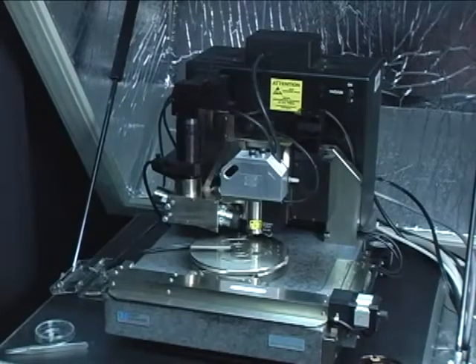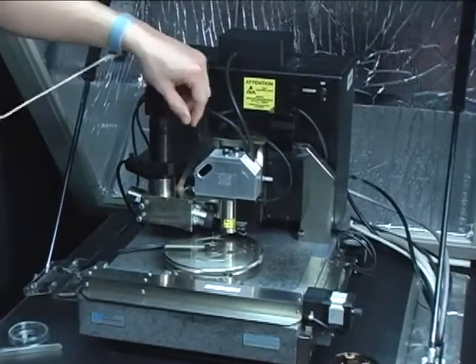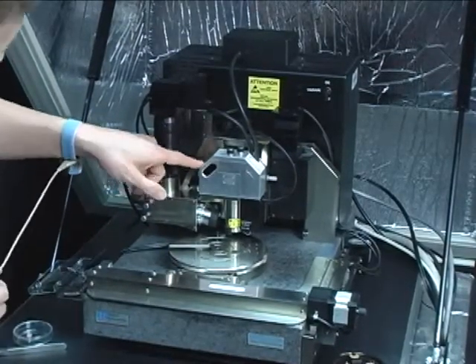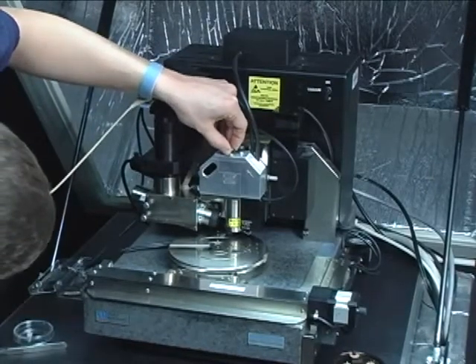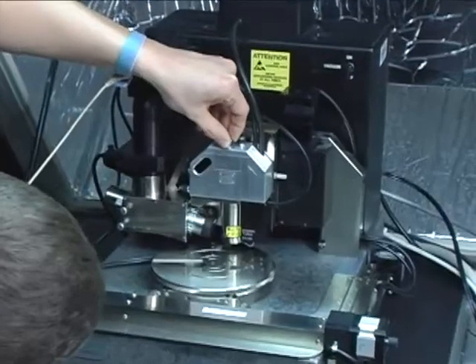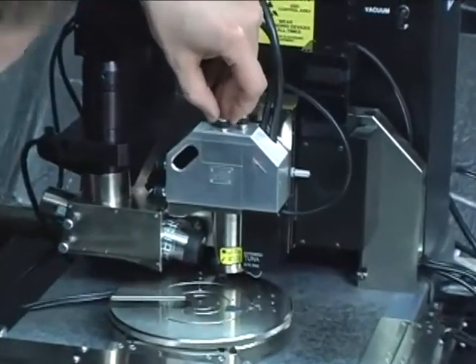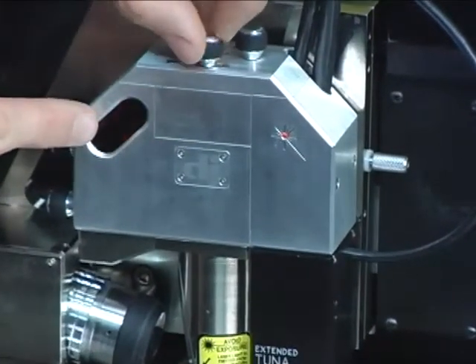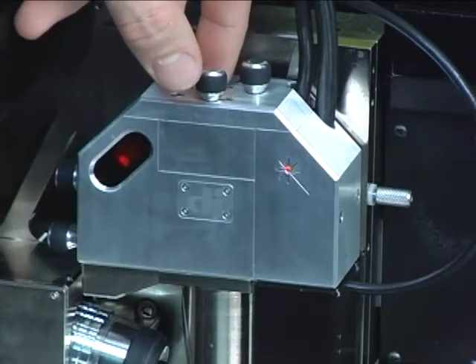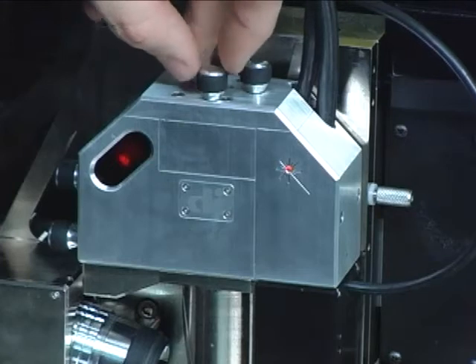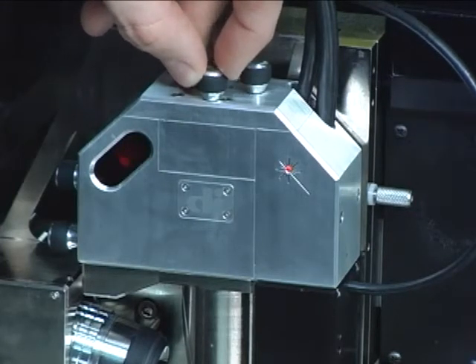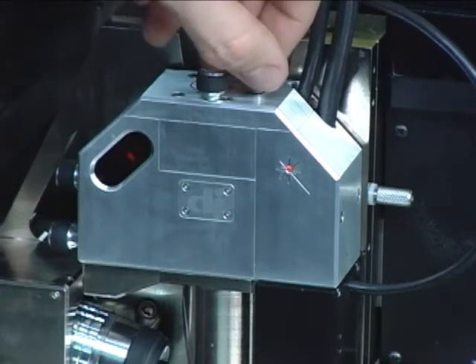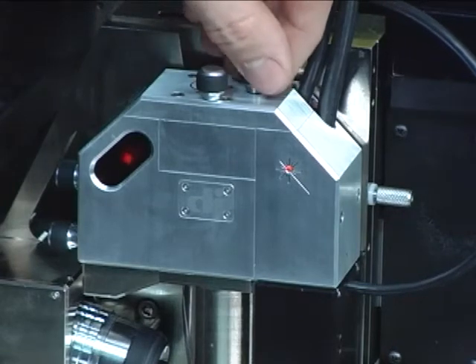Now that the tip is mounted in the system we can align the laser beam with the back side of the tip. And we'll do that by using these knobs to move the laser across the cantilever. And observing the reflection of the laser in this window. We can tell when our laser beam is on the back of the cantilever because moving it side to side our reflection will disappear very quickly. But moving it front to back we can move along the cantilever fairly well.